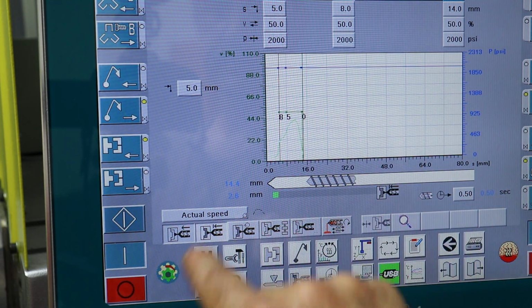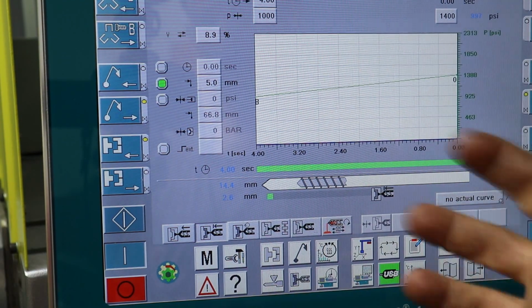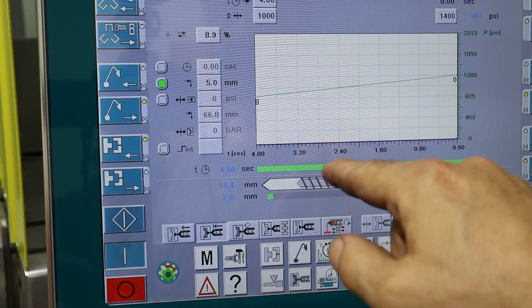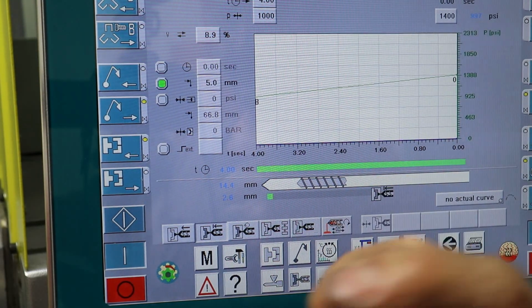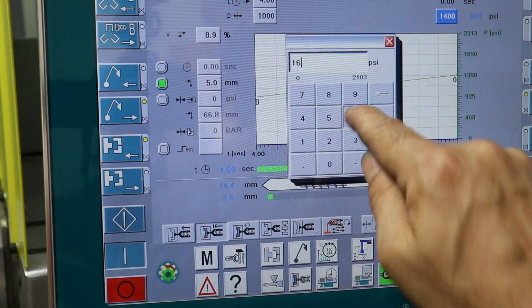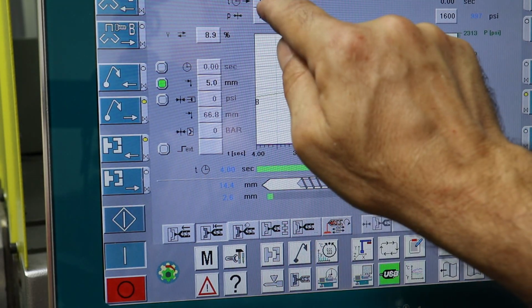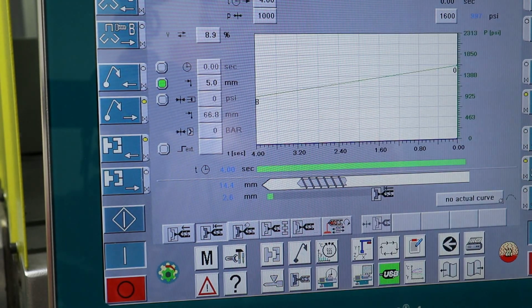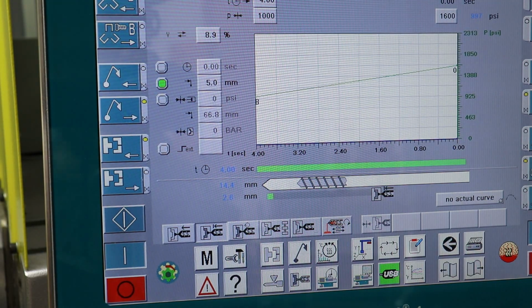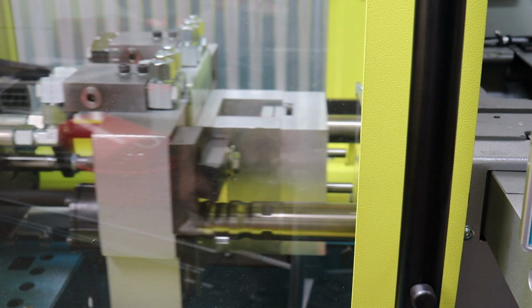And then this page here defines the packing. So once the plastic's in the mold, the auger or the injection ram is actually compressing the plastic and pressurizing the mold cavity. So it looks like we need to increase our mold pressure. And I think the time doesn't really matter. So again, we're going to be trying to optimize filling the mold, and then we're going to run it. So let's go ahead and try this.